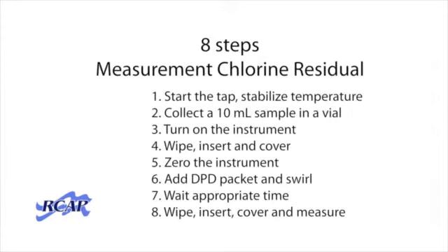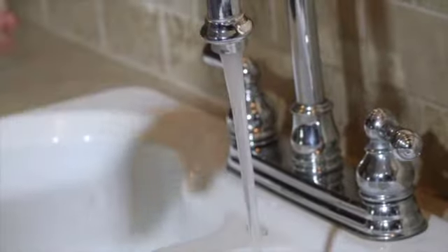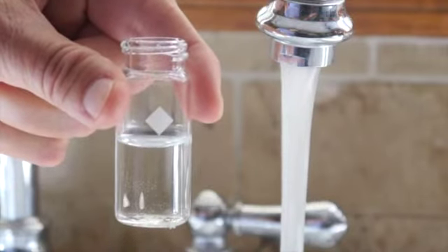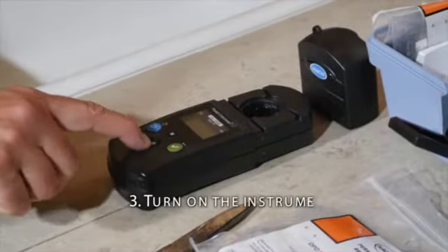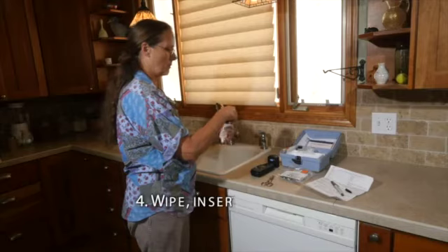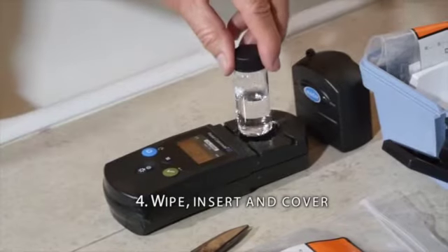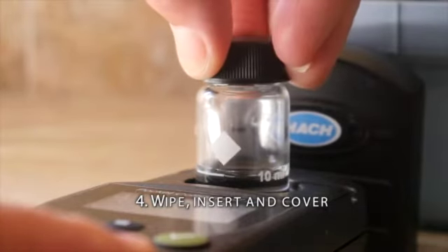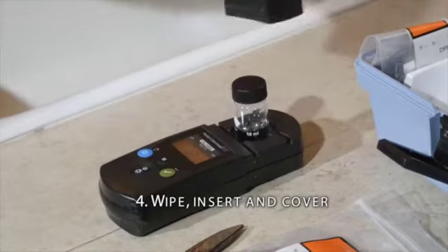Let's go through the procedure. There are 8 steps. Start the tap and wait for the temperature to stabilize. Collect a 10 milliliter sample in a vial. The 10 milliliter mark is on the vial. Turn on the instrument. Wipe off the vial with a lint-free cloth or chem wipe. Insert the vial, lining up the diamond. I point the diamond directly toward me, but it doesn't matter as long as you line it up consistently. Cover the sample.